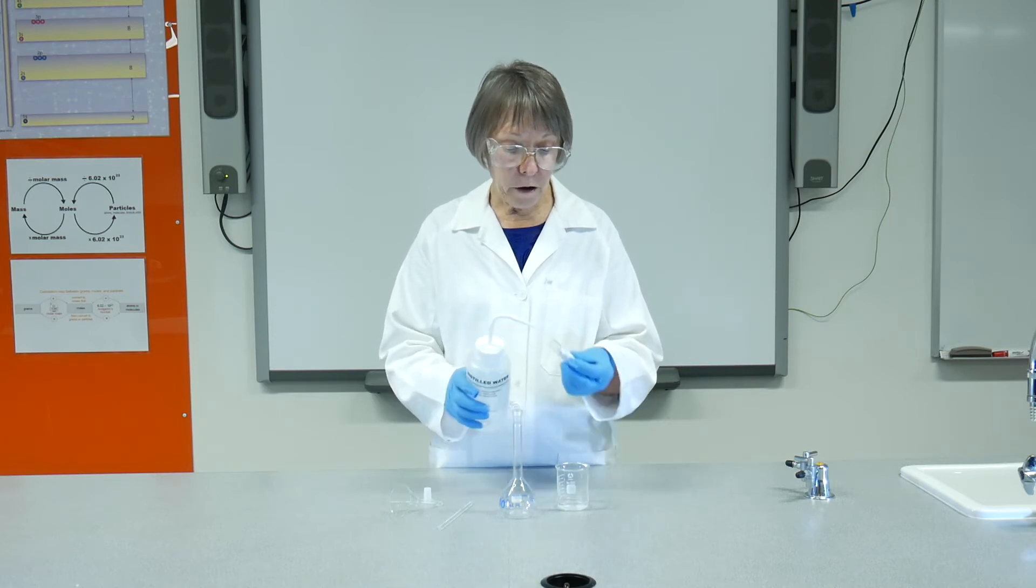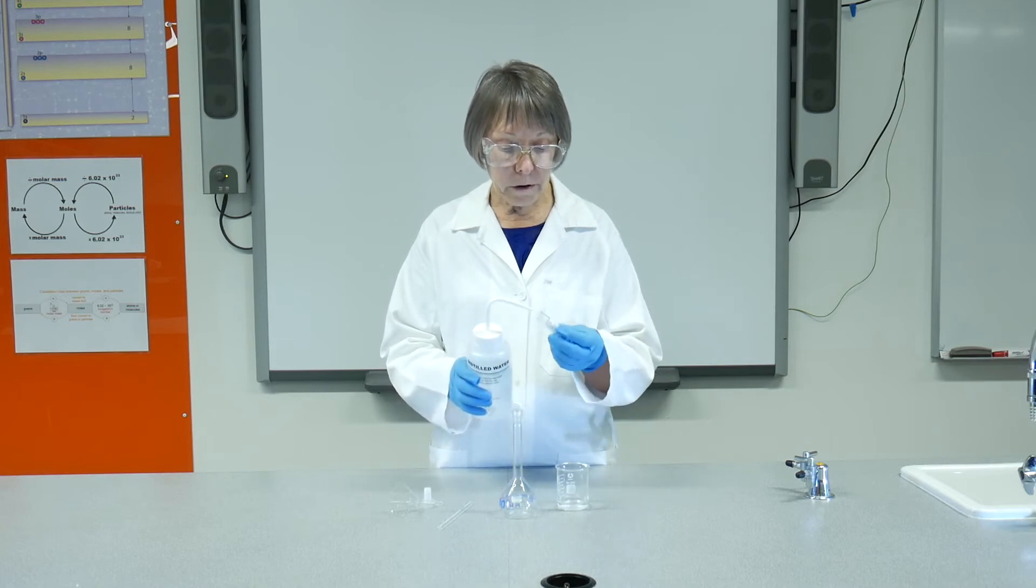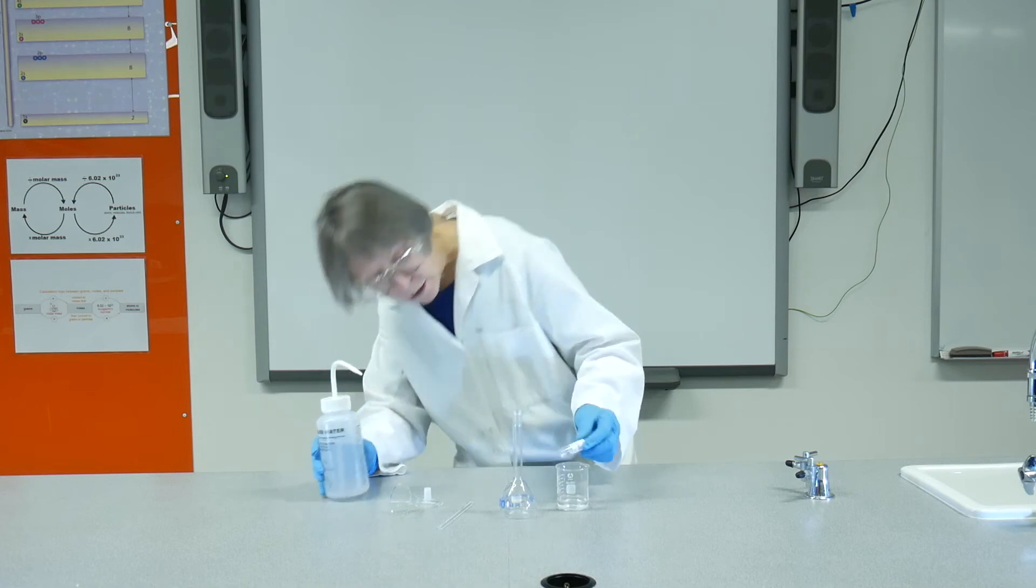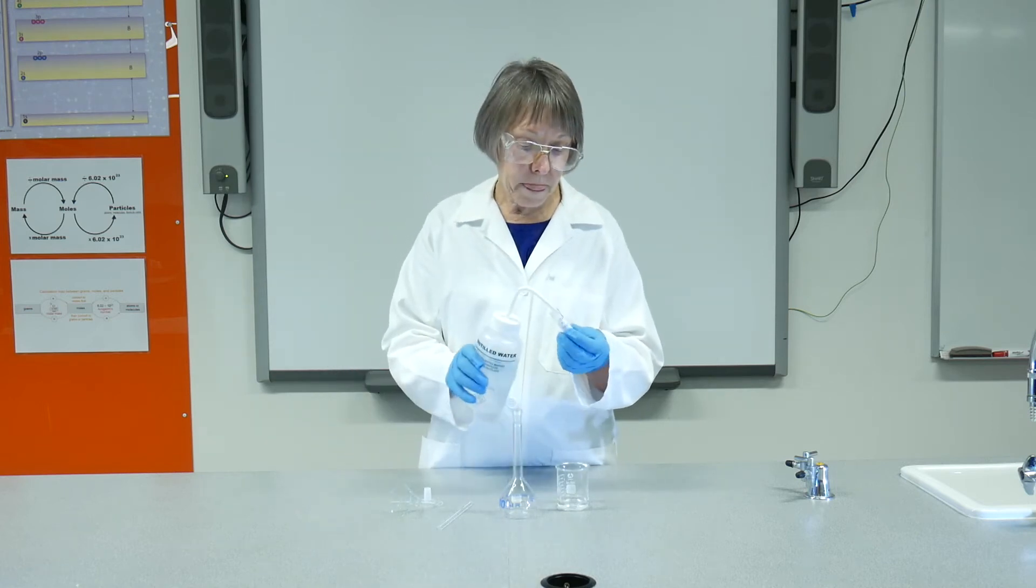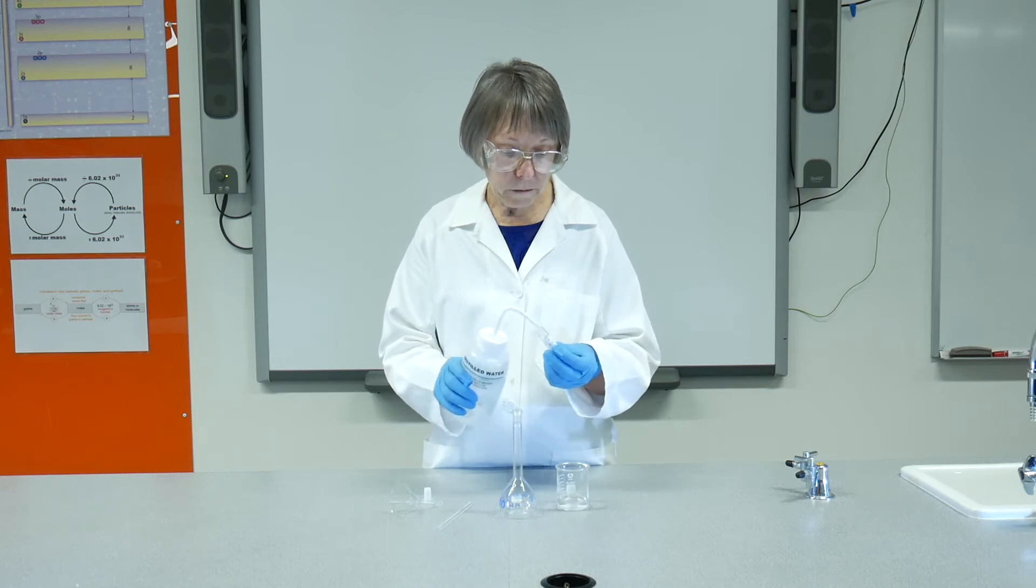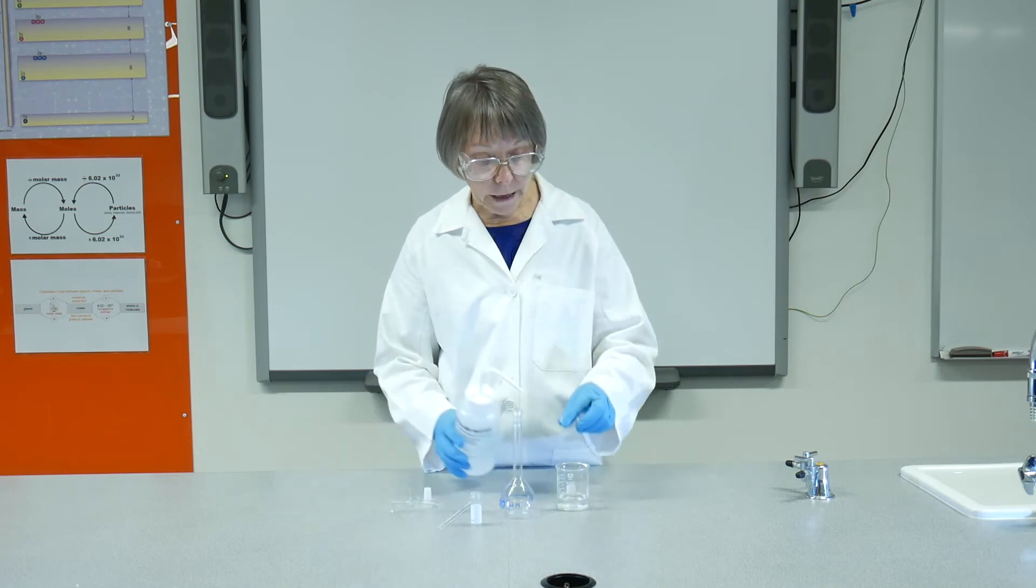And because I know I started with the acid in there, not a clean vial, I'm going to keep on rinsing until I get about 20 mL in my beaker. Also rinse the cap.